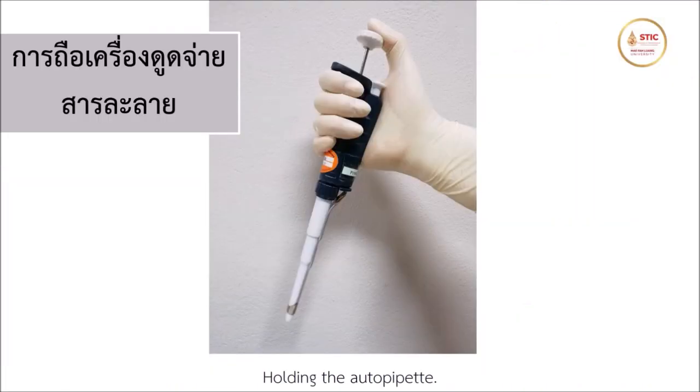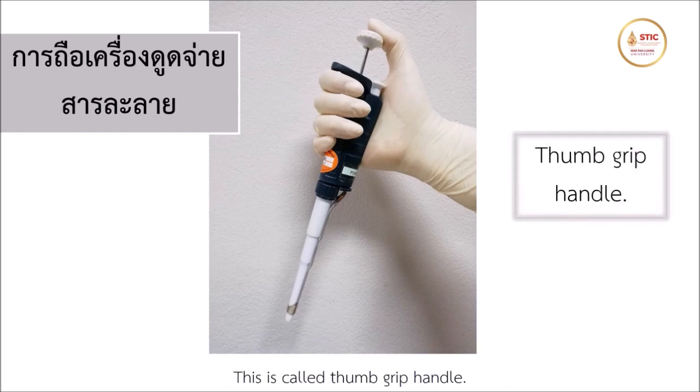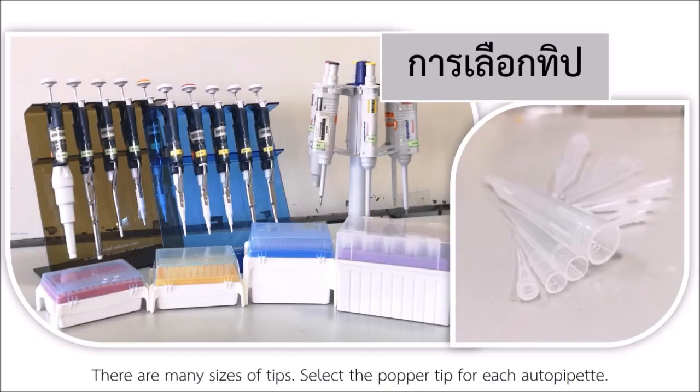Holding the autopipette. Use your dominant hand to hold the pipette. Place your thumb on the push button position. This is called thumb grip handle. Autopipette tip selection. There are many sizes of tips. Select the proper tip for each autopipette.